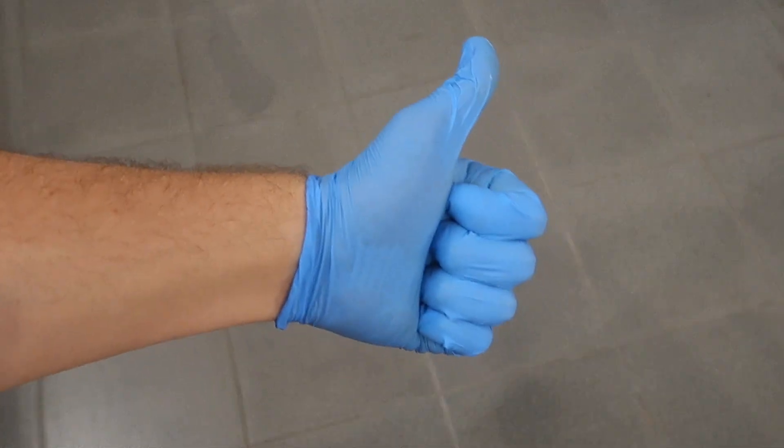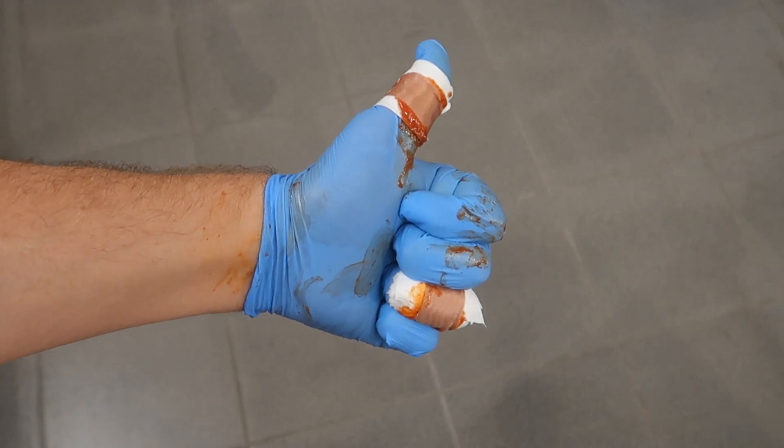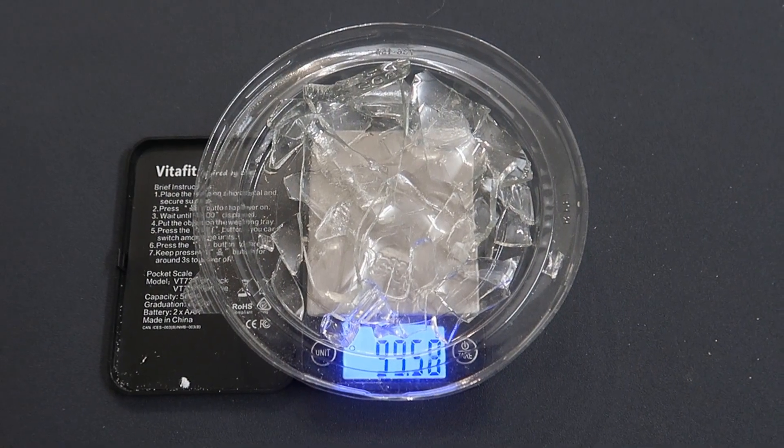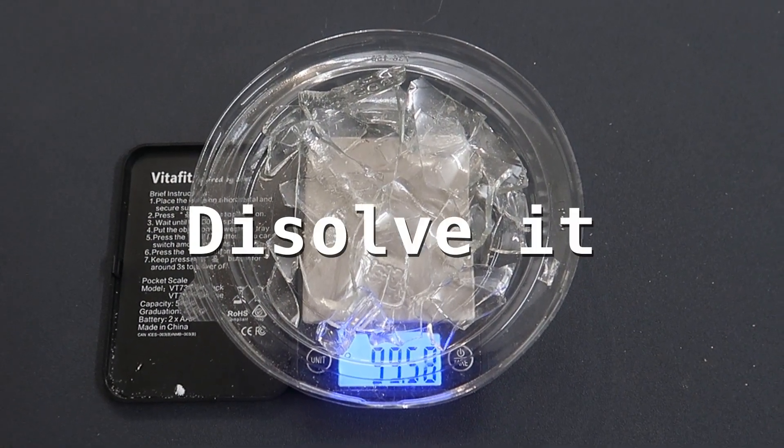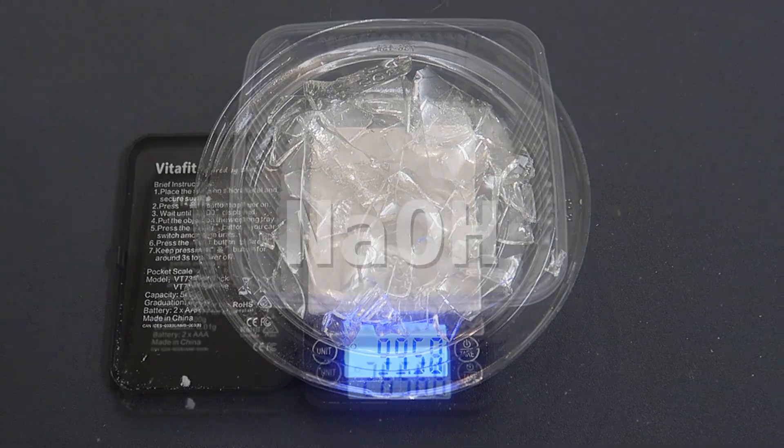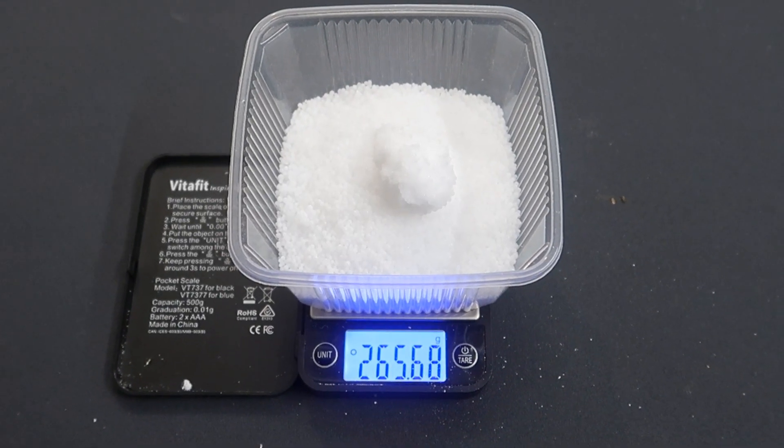Step 1: Get some glass. Done. Step 2: Break the glass. Done. Step 3: Pick up the glass. Done. Now that we have it in pieces, the next step is to dissolve it. And for this, we will use sodium hydroxide in a molten state.